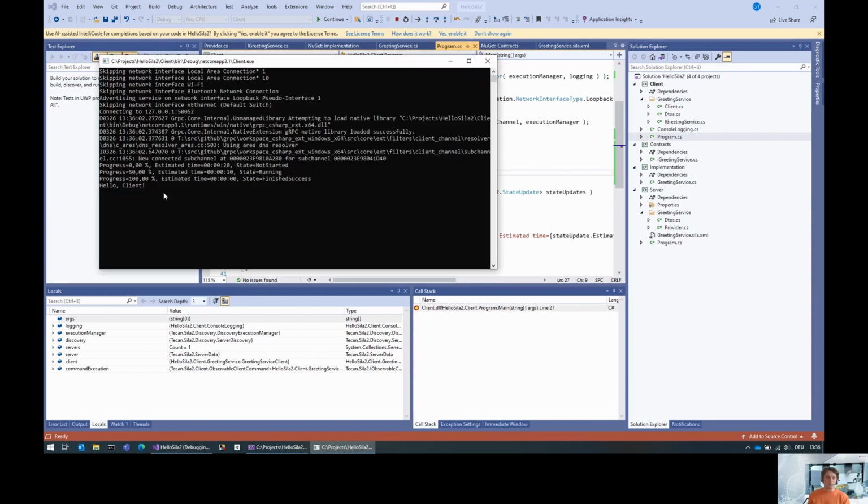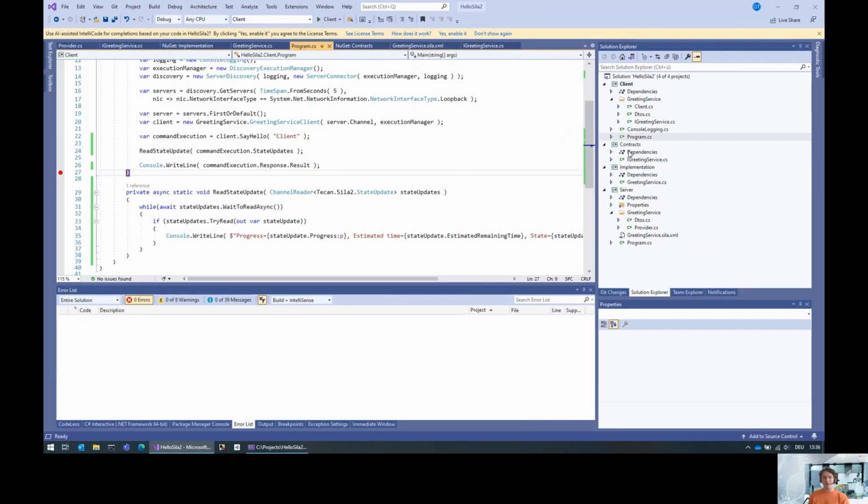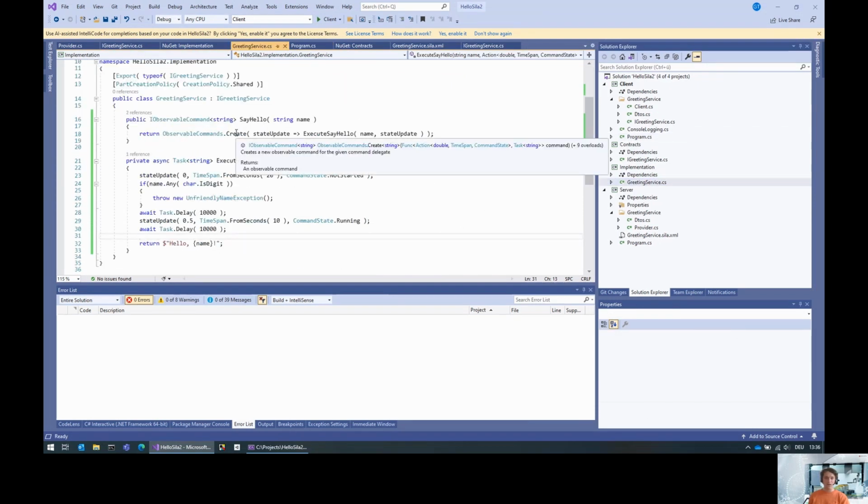And this time this doesn't close. Finally, the last message is the console write line of the response, so we got the response, hello client. Yeah, in short, this is the way you do observable commands. There is also an overload here to create intermediate observable commands. And if you want to, there are also more sophisticated ways to build up observable commands, but this is basically fine for most cases.